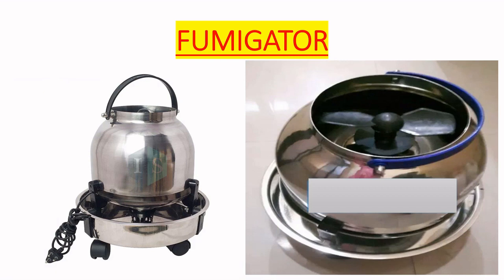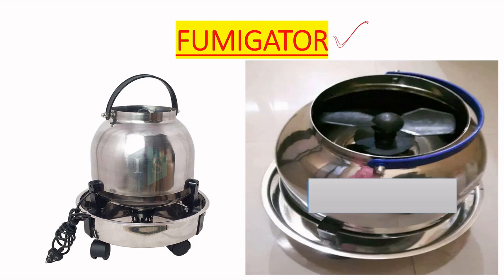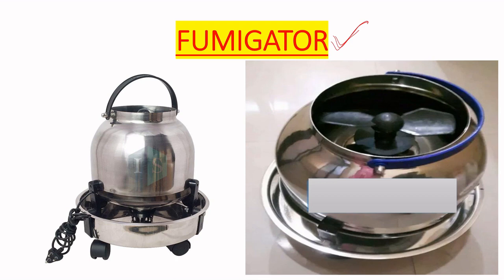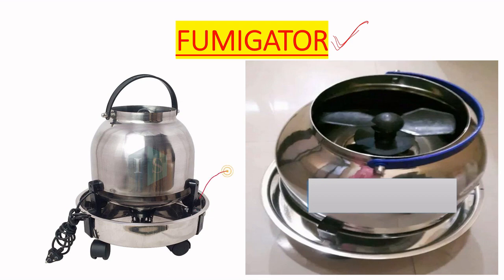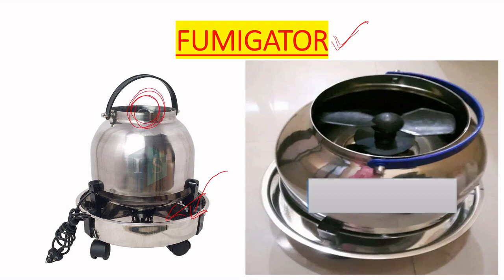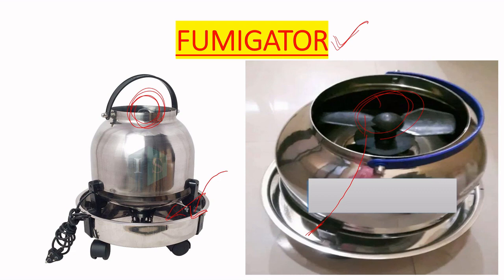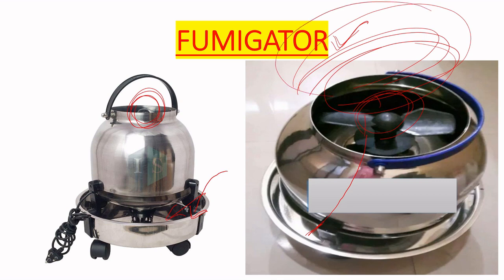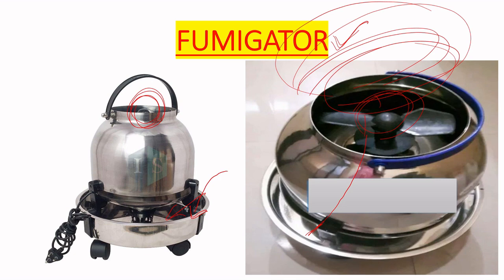The next equipment is the fumigator, used to sterilize the whole room of a microbiology lab. Fumigating agents such as formaldehyde, potassium permanganate, or peroxide silver are added into the fumigator's bucket. When switched on, a fan disperses the fumigating agent throughout the entire room, killing all microbes present. Room sterilization using fumigator can be done once or twice a week.